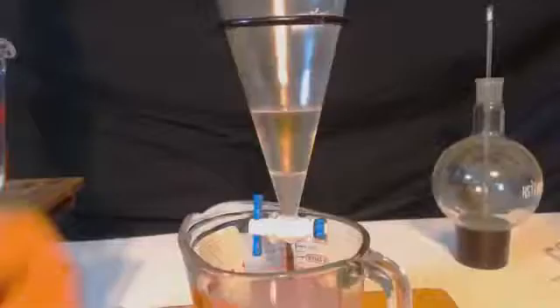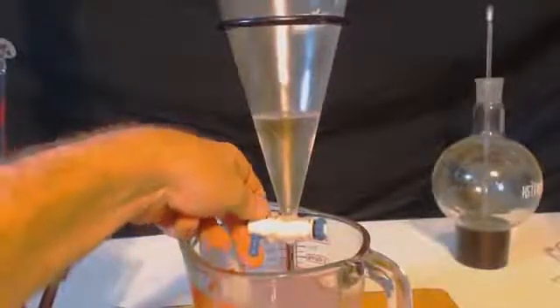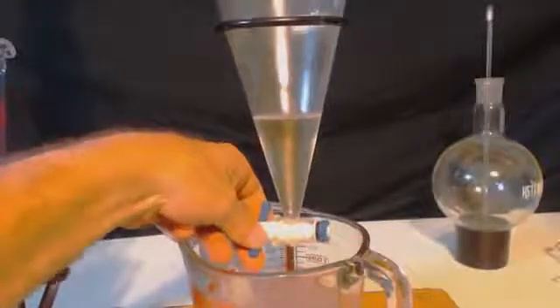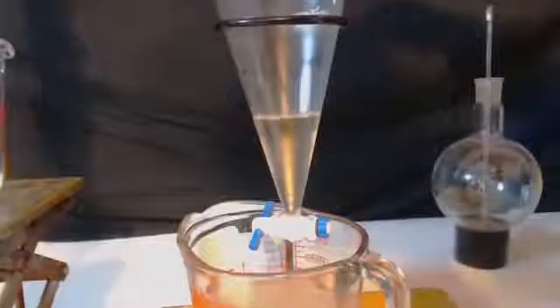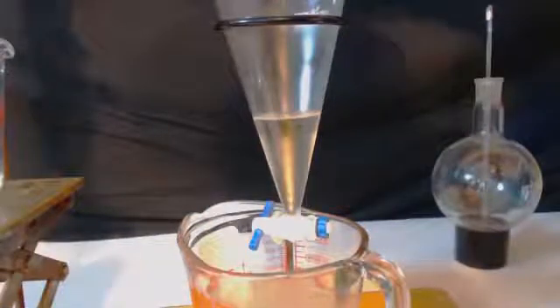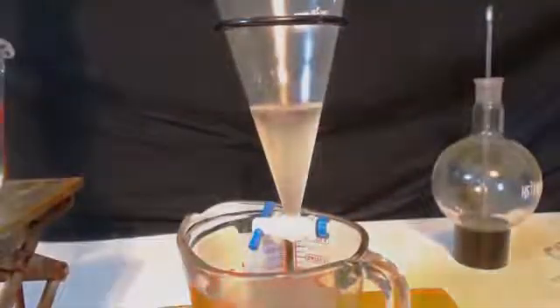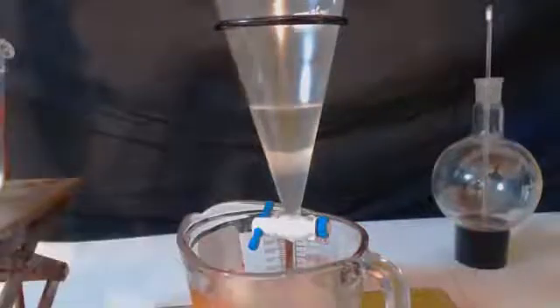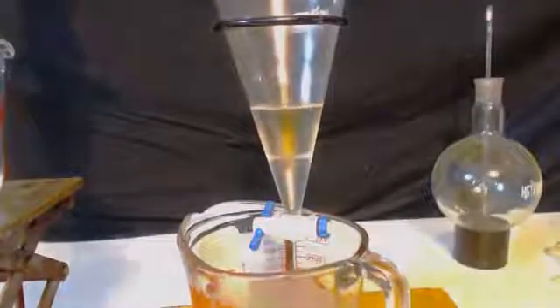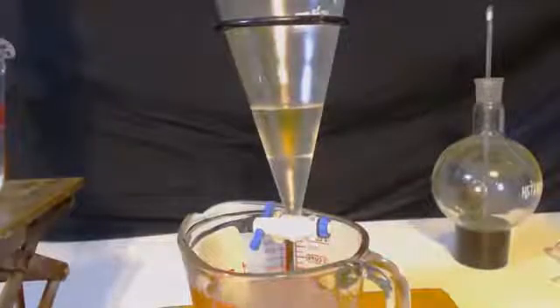I'm going to clean this out twice with the water, just to make sure, because one washing is definitely, see there's another example of the solids, but one washing is not going to take all the acetone out of there. So, this is the first washing here, and I'm going to add, you watch when I add this next washing, I'm only putting like a couple of milliliters of water in here, and yet when the two layers form, the bottom layer is going to be giant compared to what I'm putting in there. Look at where the level's at. Let me put it up for a little bit. Half of what is in there is probably, half of that bottom layer is probably acetone, and still, it was stuck inside there.